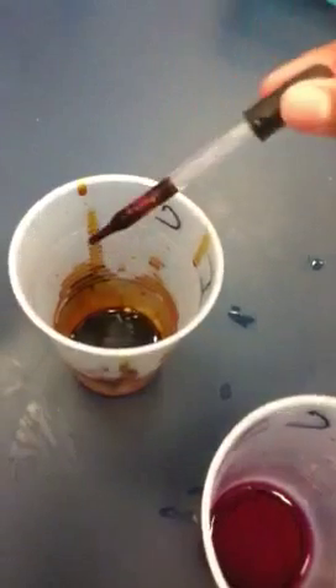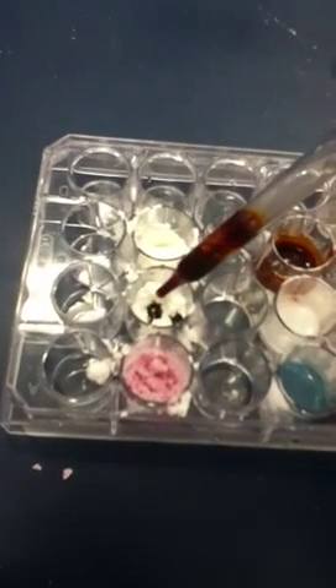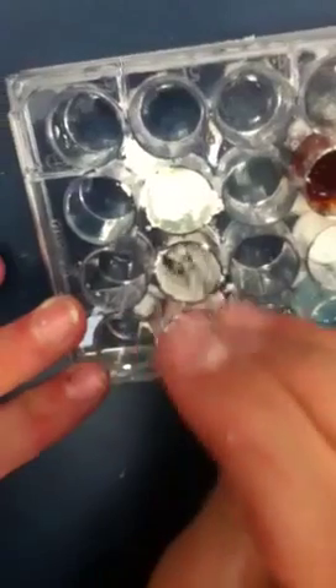Let's try it — John's gonna have to do it though. I am dying. John will do it. Put it on Facebook and I'll send it to her. Wait, what happened to the vinegar? Minus. That is black. Minus. No, it's like purple. It's like purple. Hi! Is it like — what is it becoming? It's so really smooth though. You're making us look unprofessional. It basically just happened again and it kind of became purple-ish. It's positive. It's positive. So we'll put a plus.